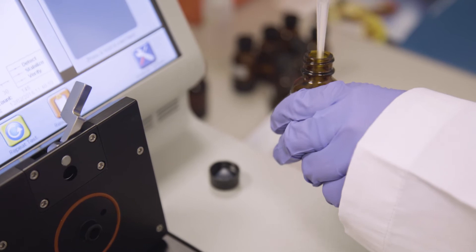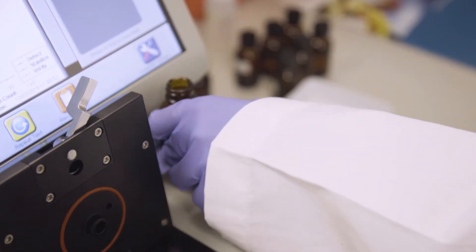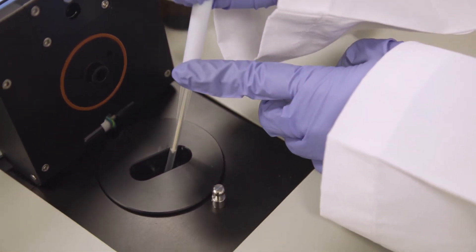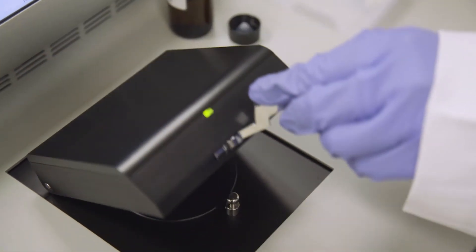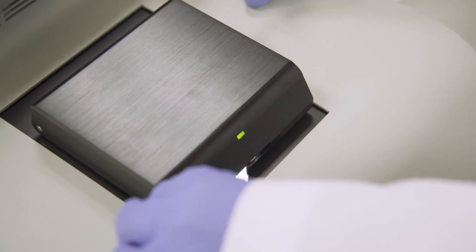Then pipette 150 µL of the next sample into the cup. Repeat these two steps twice. Use a third aliquot for the actual test.